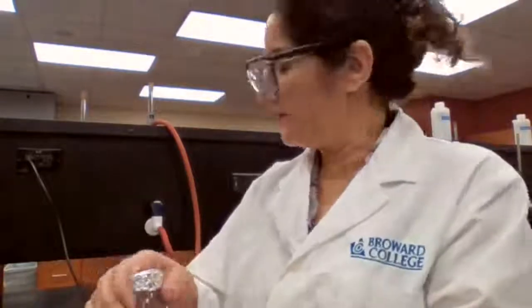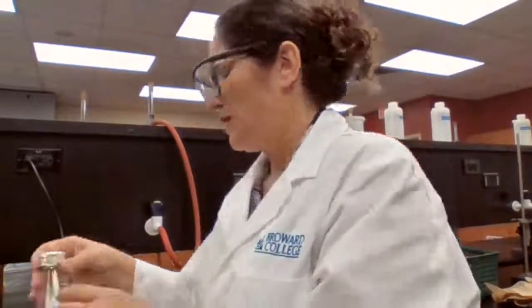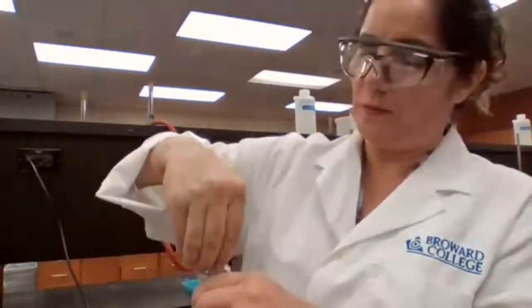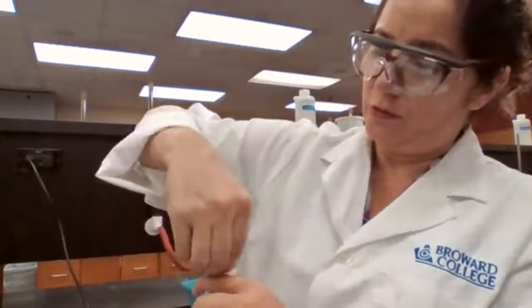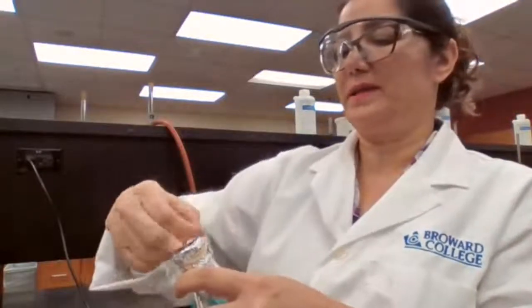So now that we have the mass, we are going to get more of the sample and perform the same experiment one more time for 2 trials. So in case there is one positive error in one trial, we get negative error on the other one. They cancel each other. It's better to take average of the 2.